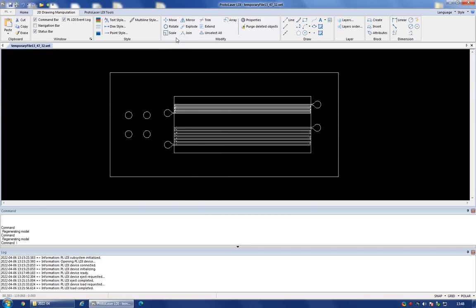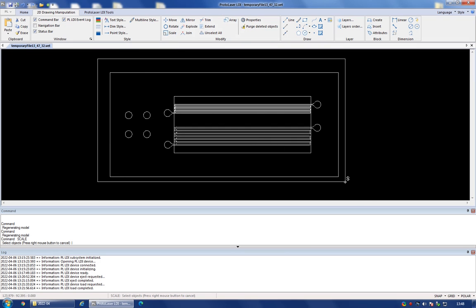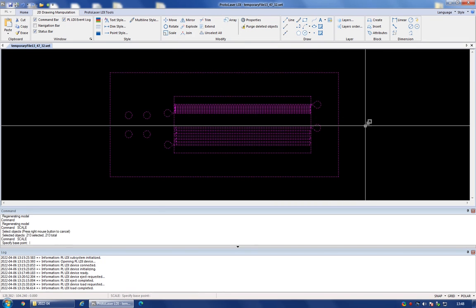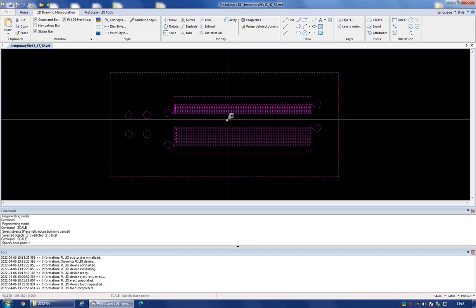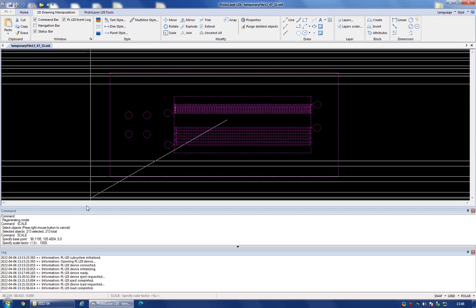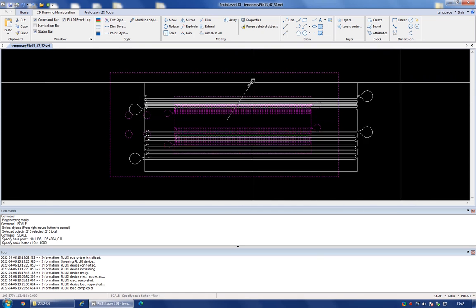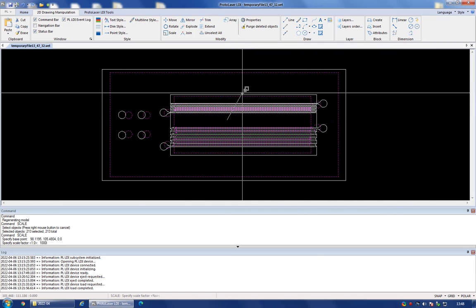So I'm going to select the scale tool, and I'm going to select the whole structure, right click, and I can select the base point somewhere here, and I can input the value 1000. And you're going to see that in the command bar down here. You don't want to be scaling it by hand, even though you can, but you want to input an exact number, which is the one that you know is correct.